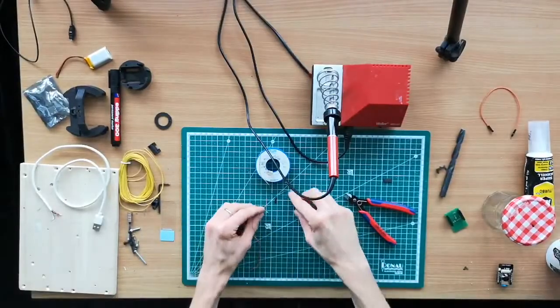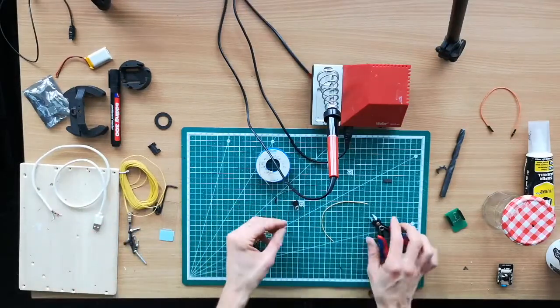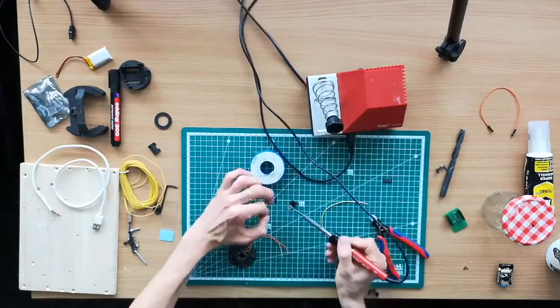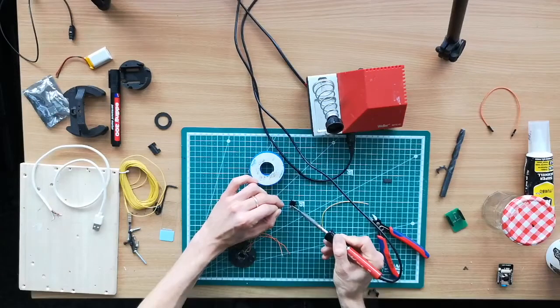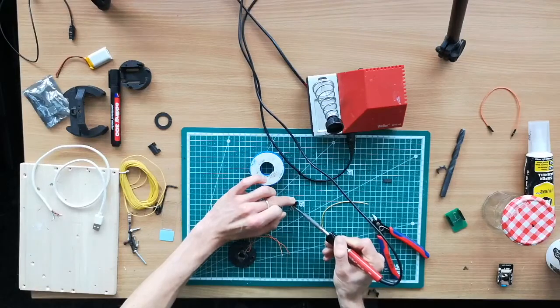So as I said, the base is controlled by the ESP. So this connects to a pin I'm showing you later. So we need one wire. This here goes to one pin, which you'll also see in the sketch. So first of all, I just add some lead to all the pins. That makes it a little easier to solder. Make sure you do a proper connection.